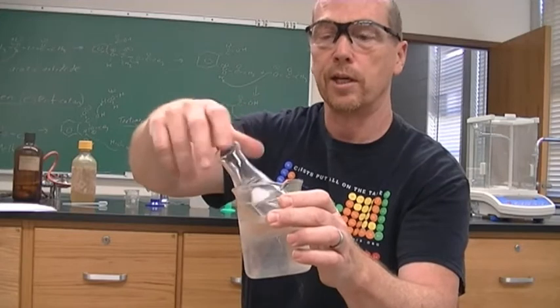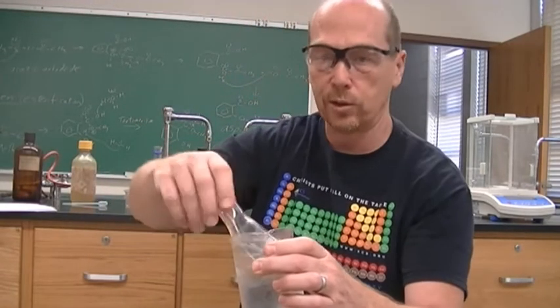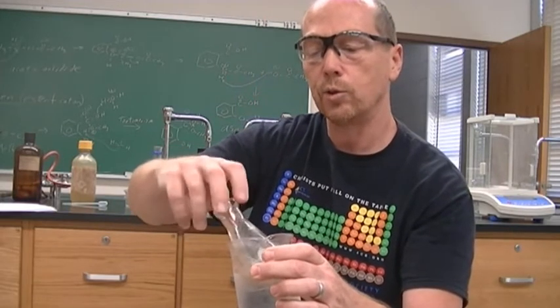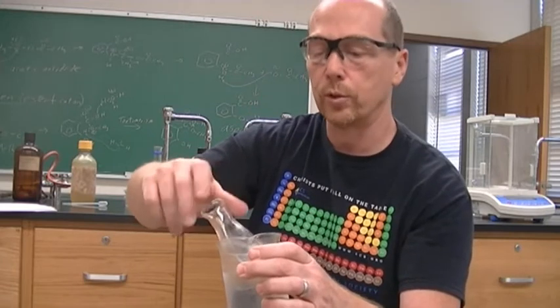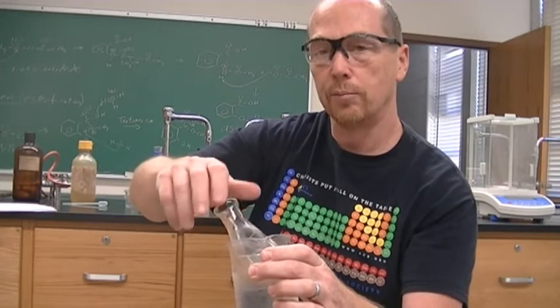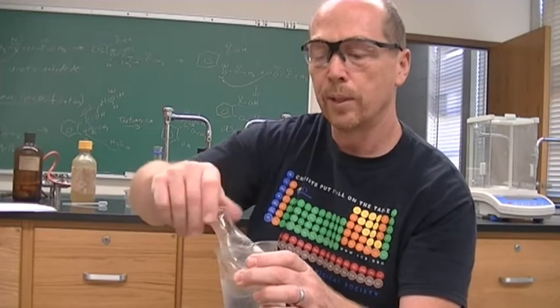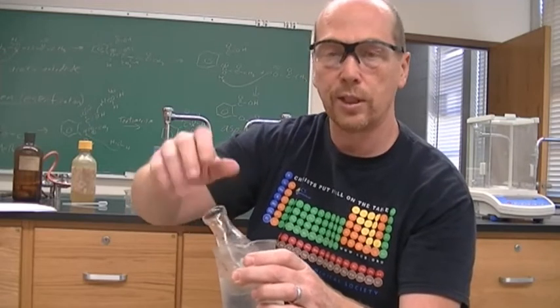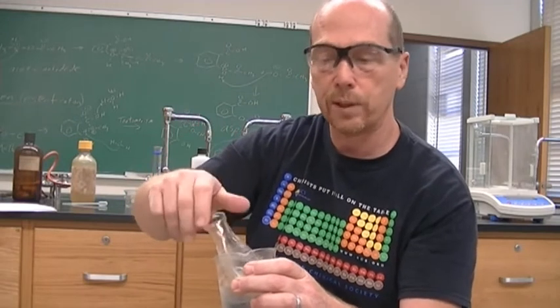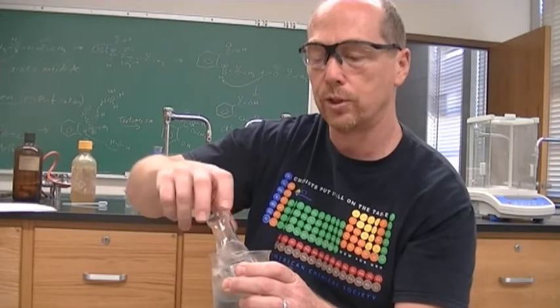anytime you're doing organic synthesis and making a solid, you're going to have to crystallize it, which purifies your solid. Sometimes you have to crystallize it again, which is a recrystallization to get it even more pure. And sometimes these do not want to crystallize, and you have a lot of different techniques. One of them is to add a seed crystal. So if you have some aspirin, you can add a little piece of aspirin, and then it grows from that one piece. That's called a seed crystal.